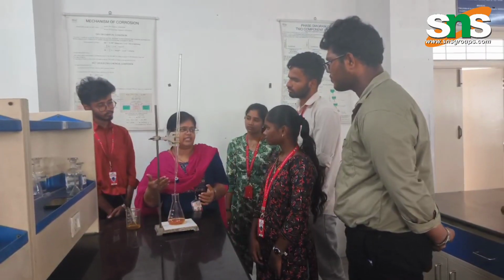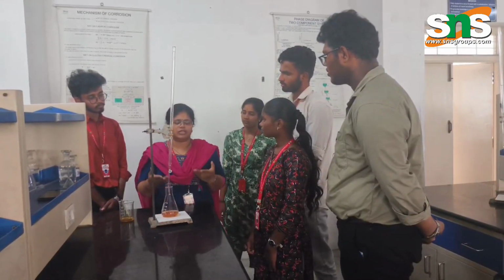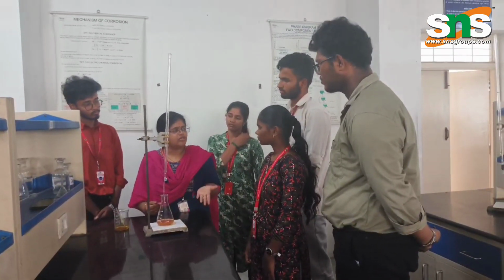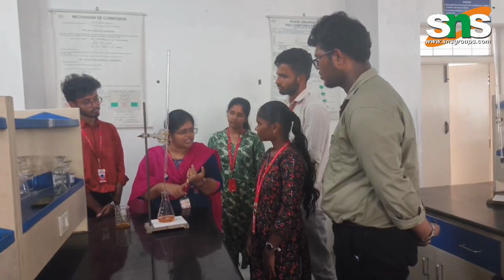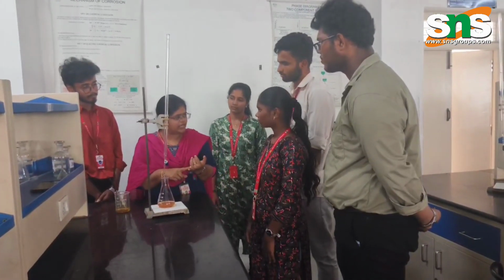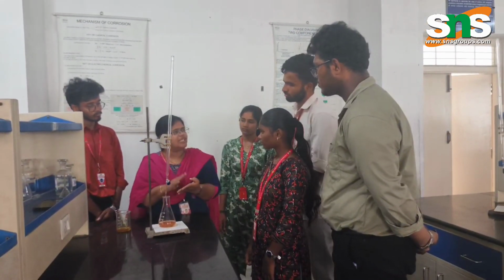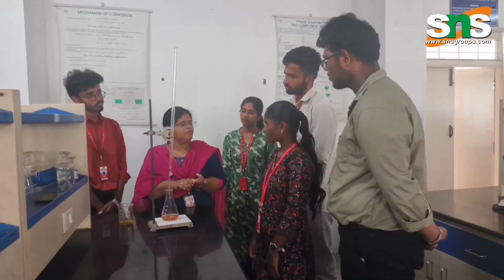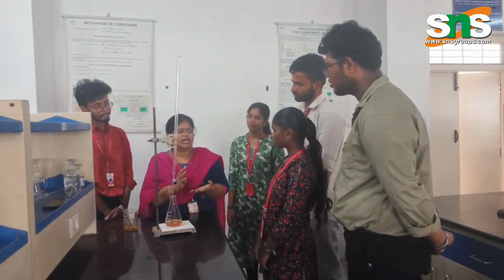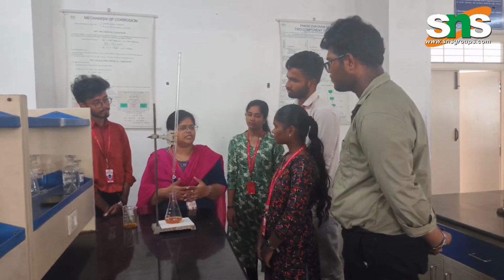If you want to test water, you can bring water from your home and do various different types of tests, not only chlorine analysis. You can measure the pH of domestic water, and estimate alkalinity and hardness. You can find how much of each substance is present in the water.